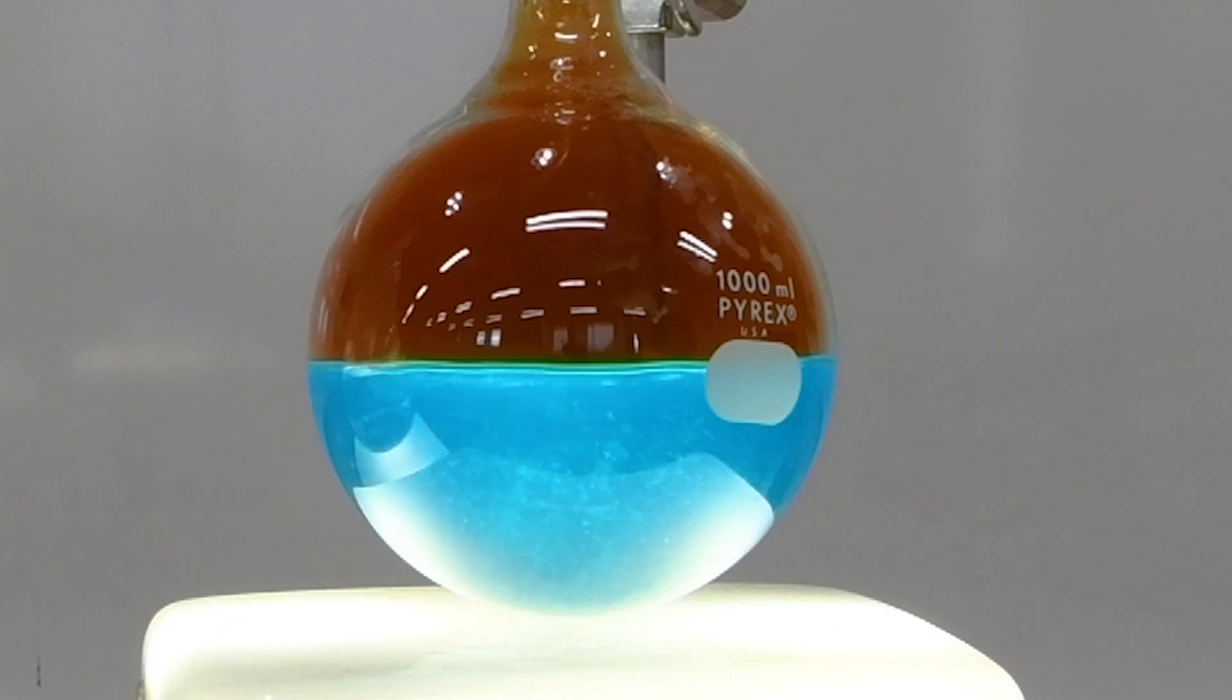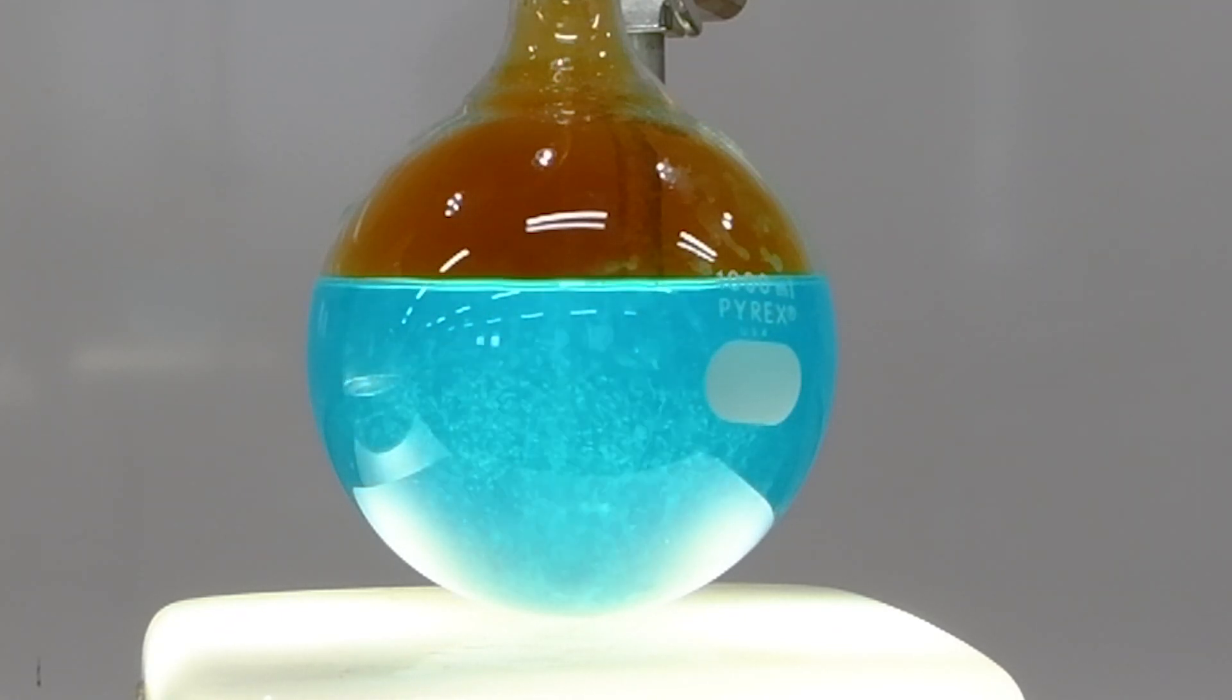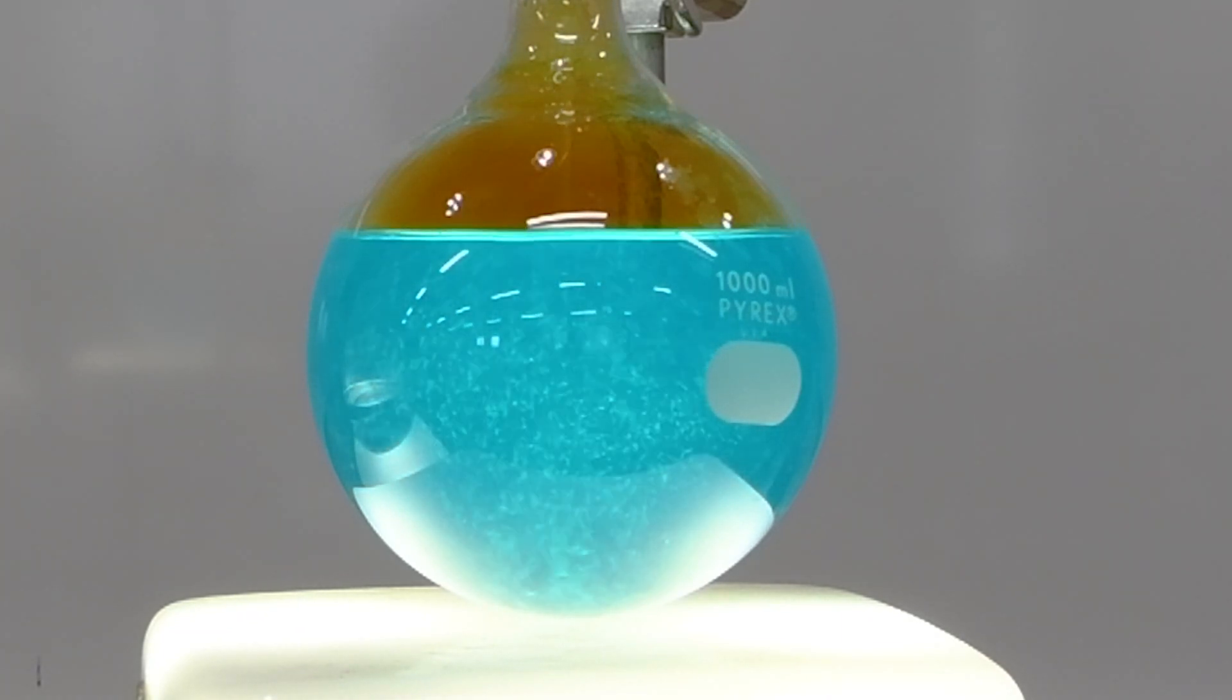Lots of pretty colors, lots of interesting chemical reactions. I think Ira Remsen would be proud to have this demonstration named after him.